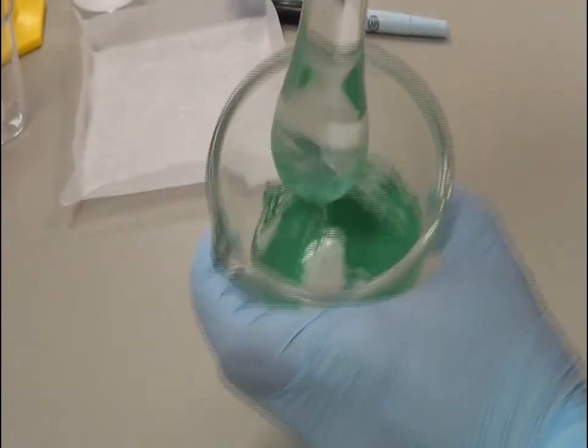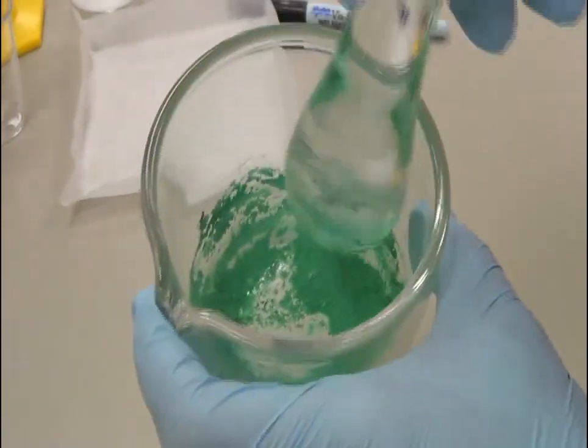This powder is now homogenous. I use a sieve to make sure that I have uniform particle size. I am going to use the spatula to scrape the mixture — the drug and the ascorbic acid mixture — and scrape everything from the mortar so that I have all the drug and the inactive ingredient accurately.